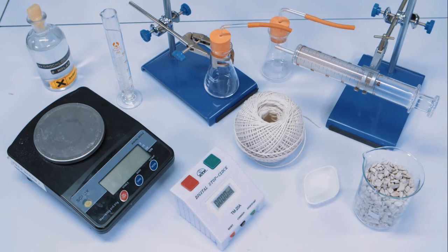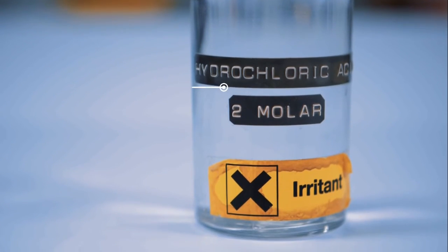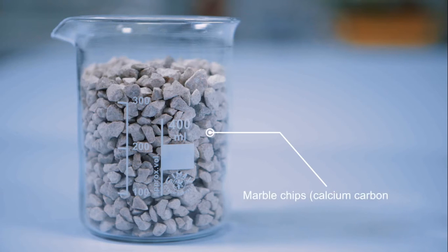In this experiment, we will determine how the concentration of hydrochloric acid affects the rate of reaction with calcium carbonate. Various concentrations of hydrochloric acid will be used, and calcium carbonate as marble chips.